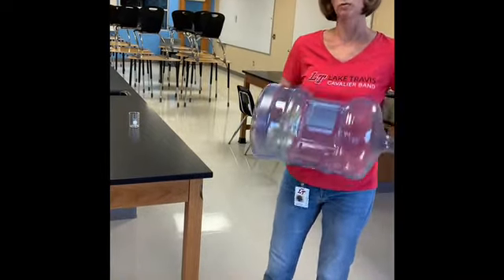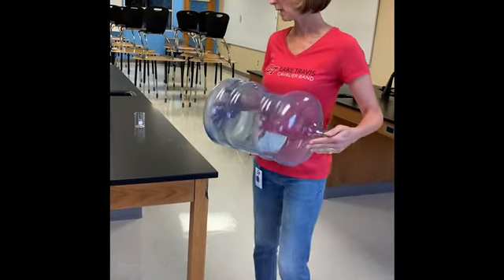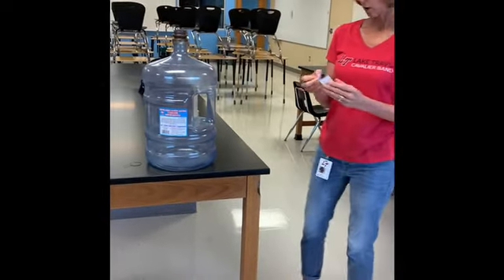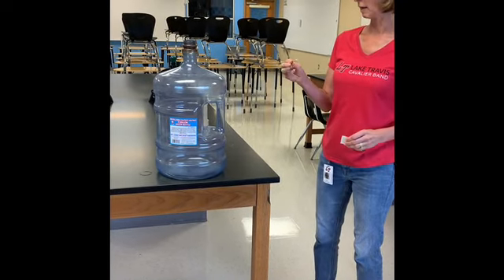When I tell you where you need to dispose of things and how you need to handle them, you need to do that properly because you just never know what things really are. So this water — how would we expect it to react if I dropped a lit match in there?